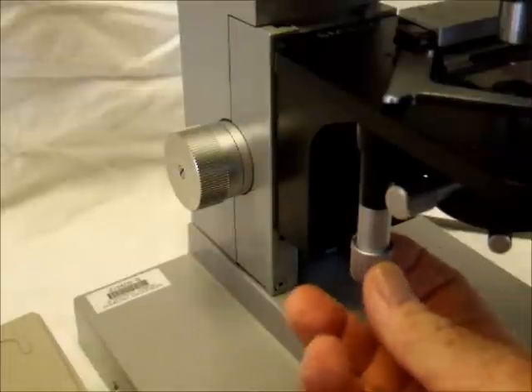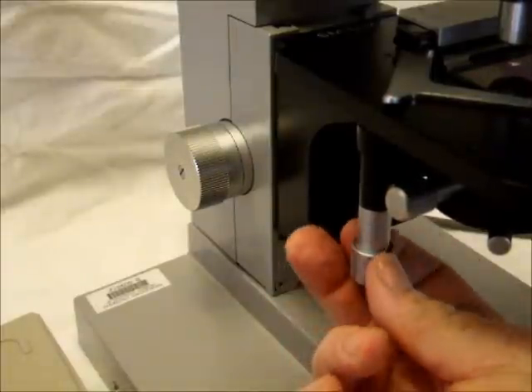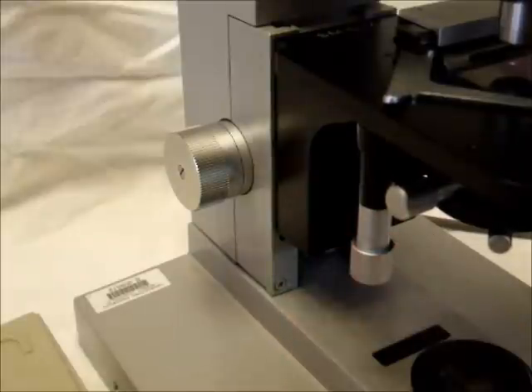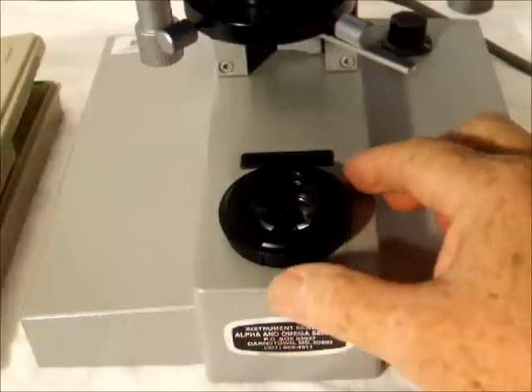Step 7. Adjust the height of the condenser until the edge of the light is sharp and the spot of light is as small as possible. The figures on the left and right show what the light looks like before and after adjusting the height of the condenser respectively.